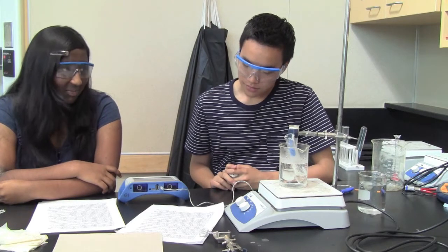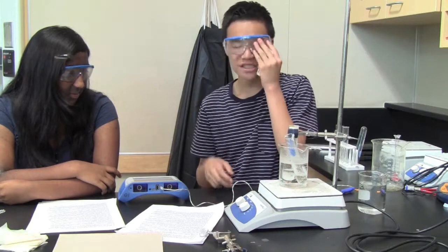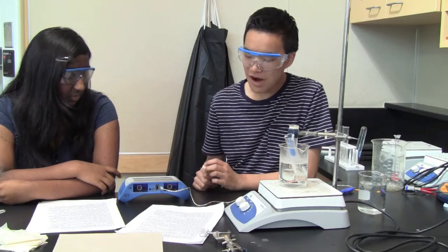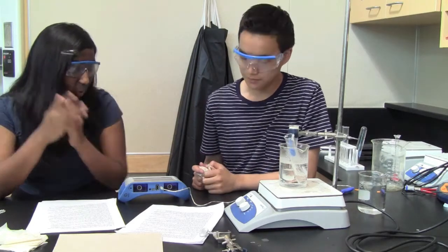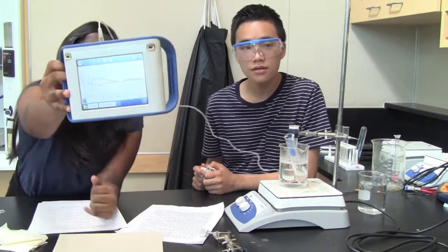Paper towels. The freezing point of the citric acid, lauric acid solution can be determined by finding the temperature at which the mixture initially started to freeze. Unlike pure lauric acid, the mixture results in a gradual linear decrease in temperature during freezing, which we can see in this. Look at the reddish orange line.